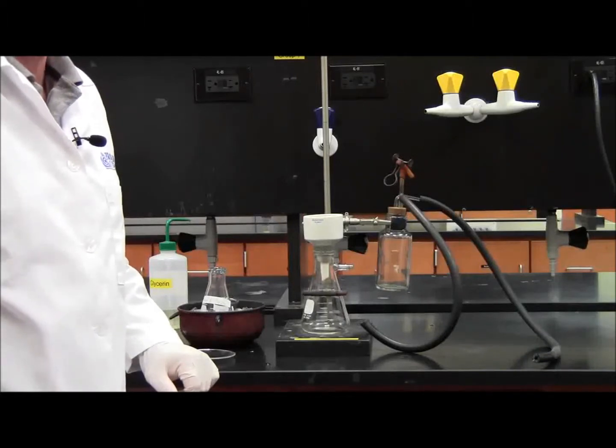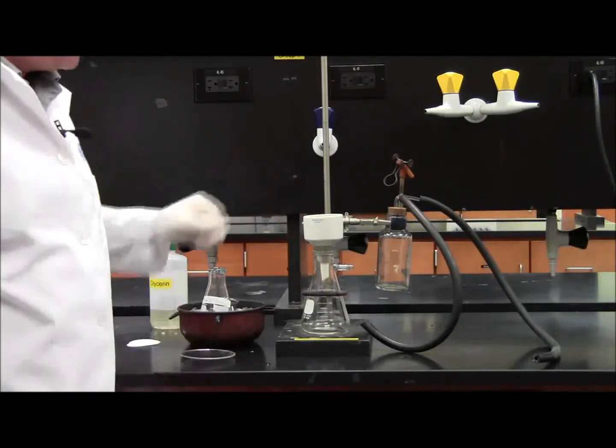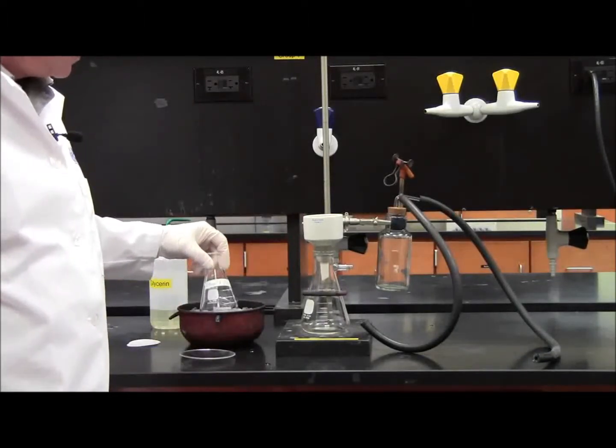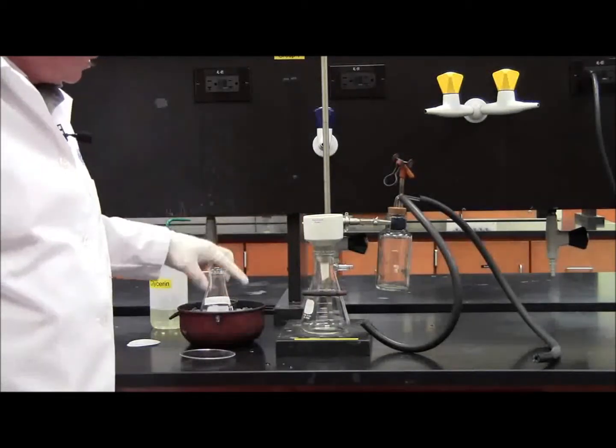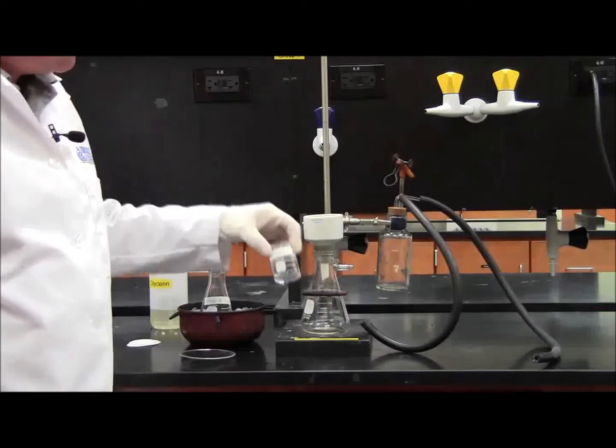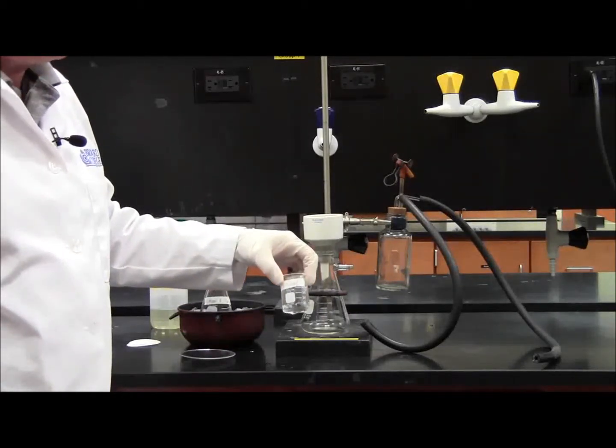It's been 10 minutes since the benzoic acid and ethanol have been placed in the ice bath here. You can see there are plenty of crystals. The ethanol has been cooling for a long time, so it's plenty cool for the rinse.